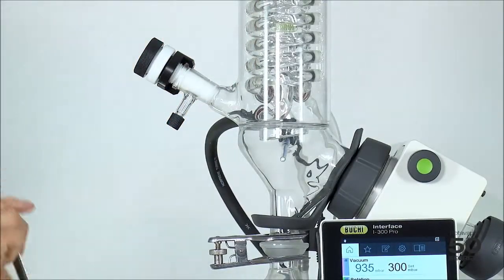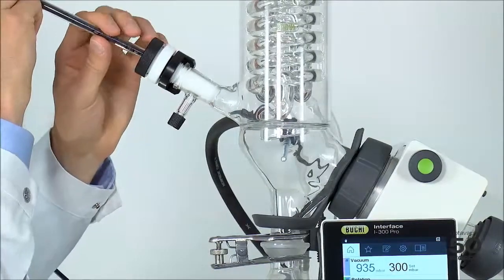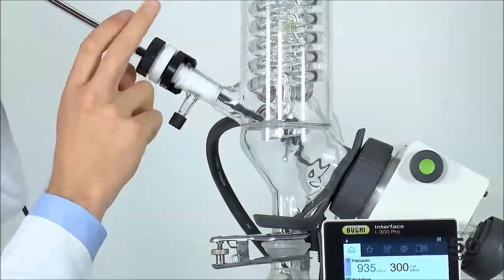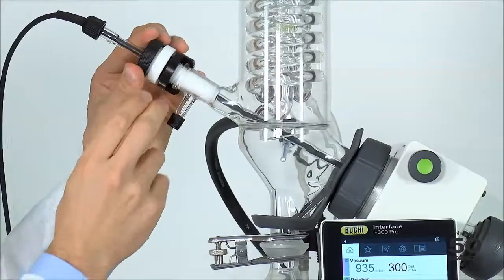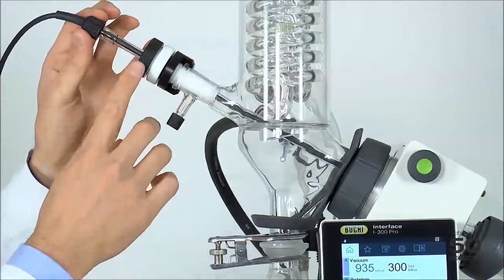Now we use the foam sensor and we insert it through that hole just completely. I will talk about that in a minute like this and we keep it open.